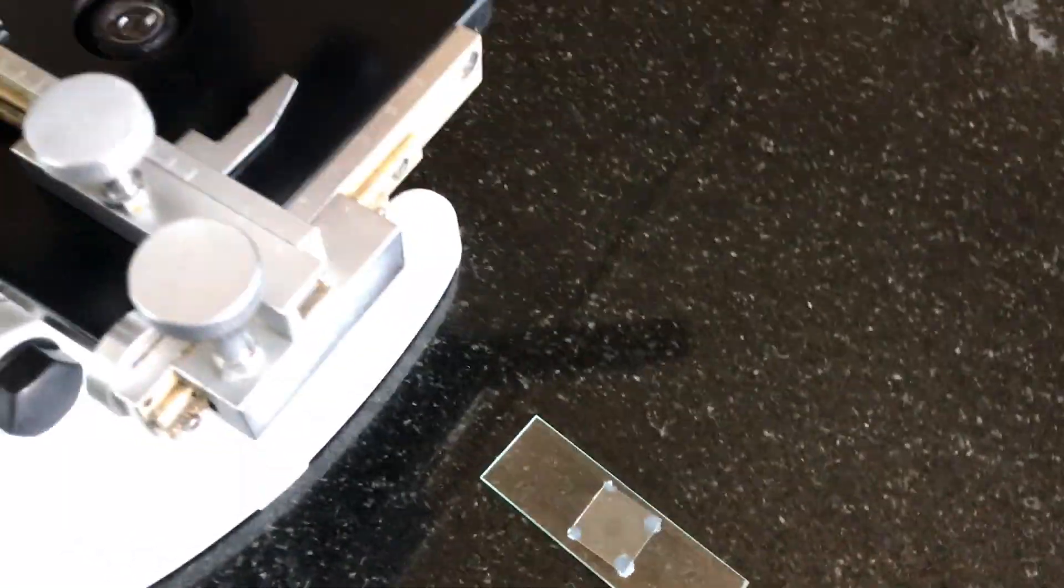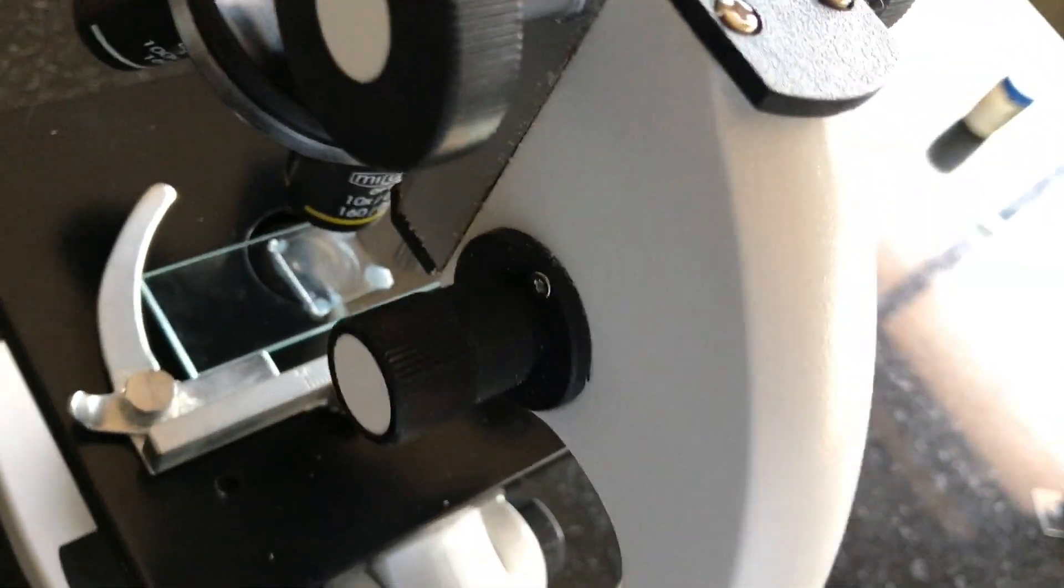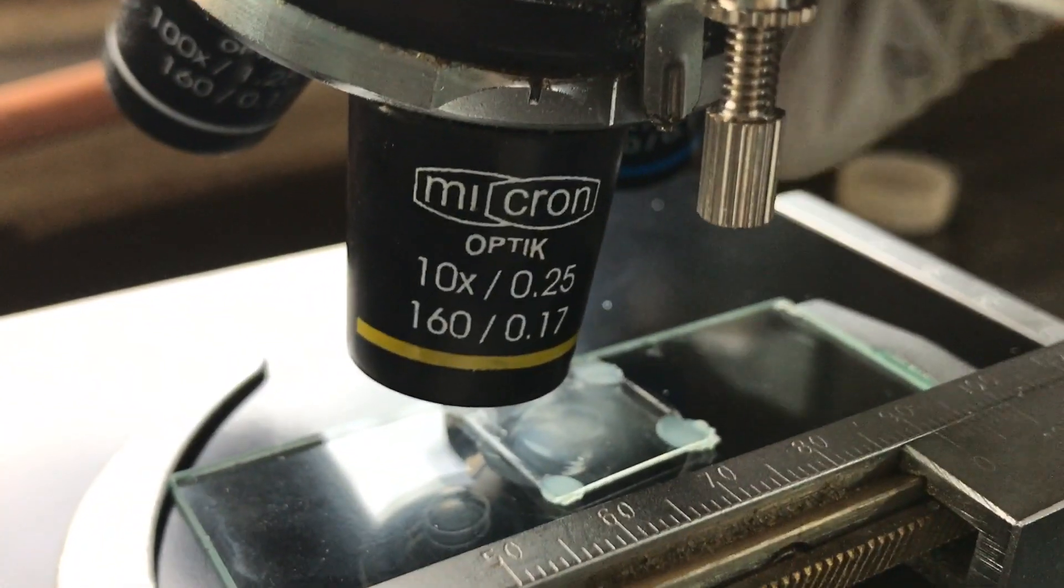Hello everyone, this is my microscope. I am going to mount this sample over here. So I have mounted my sample and now I will adjust the objective.